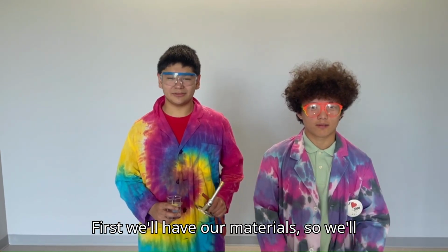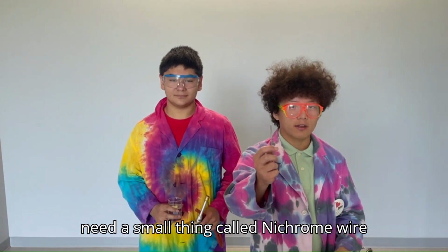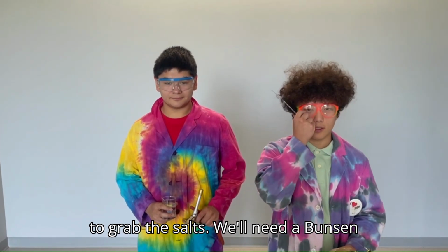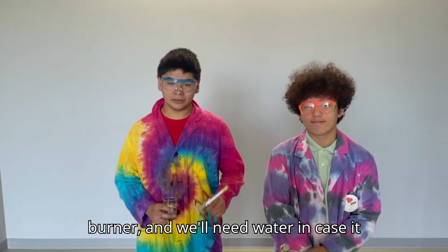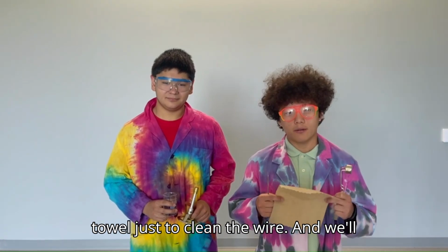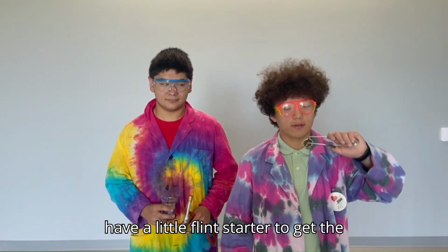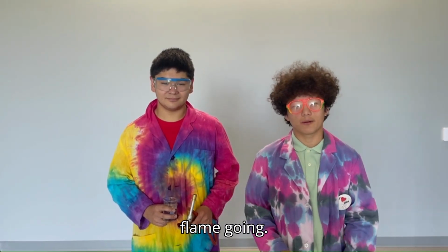First, we'll have our materials. We'll need our safety goggles to be safe. We'll need a small thing called nichrome wire to grab the salts. We'll need a Bunsen burner, and we'll need water in case it gets out of hand. And then we'll need a paper towel just to clean the wire. And we'll need small amounts of the solid, and we have a little flint starter to get the flame.